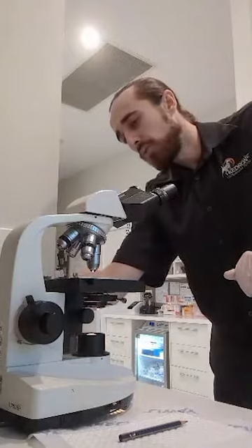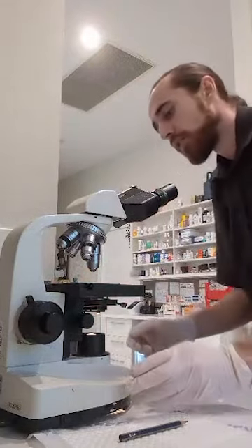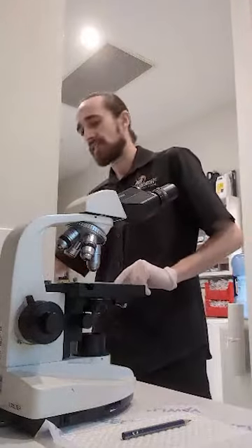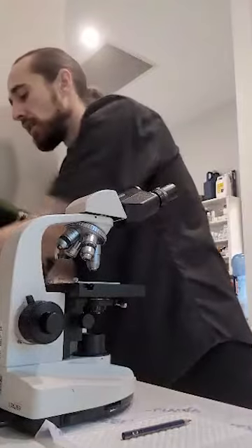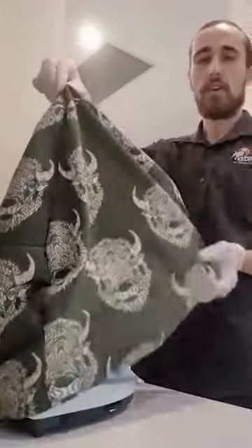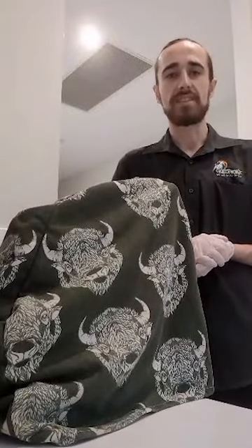And to close, we will lower the stage, close the iris diaphragm, turn off the microscope at the wall, remove the sample, discard into the sharps container, turn off at the wall, give it a good wipe over with Kim wipes, and make sure it's free of any dust, foreign debris or contamination, and place the microscope cover over the top. But other than that, that is everything today. That is Practical Assessment 18, performing a blood smear, attempt 2.